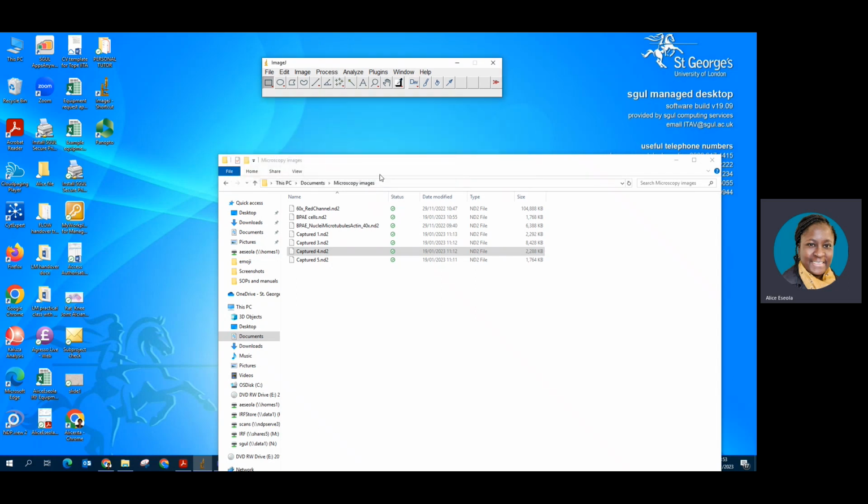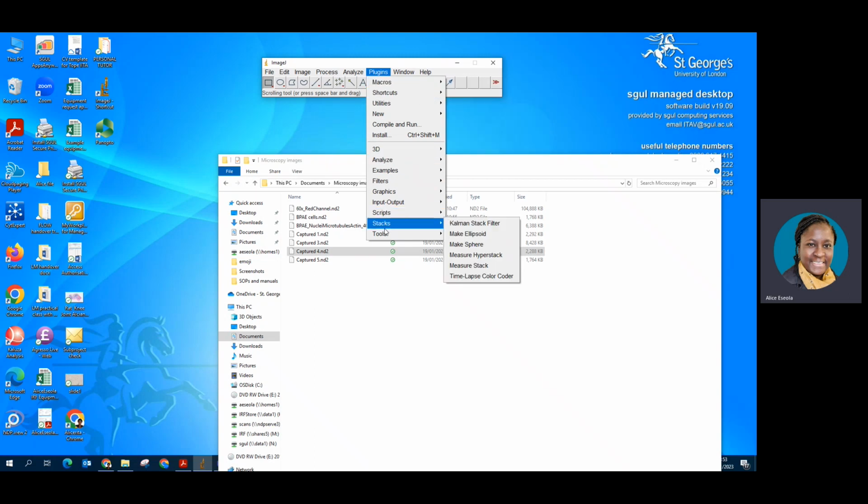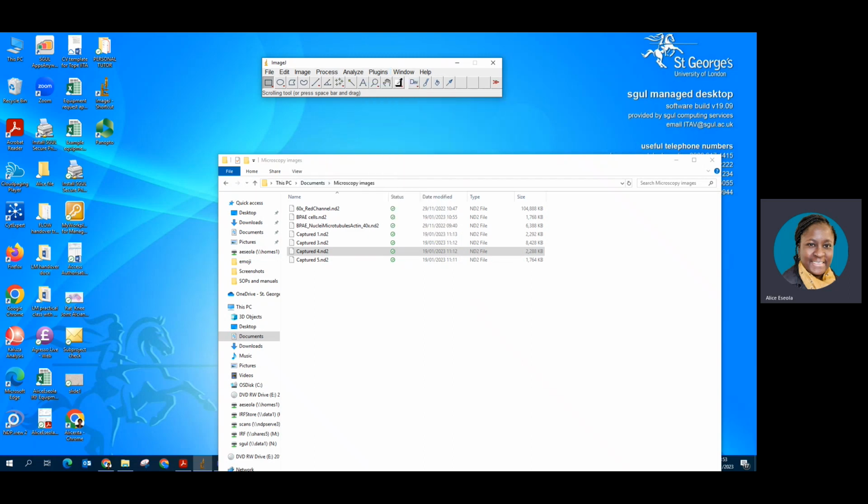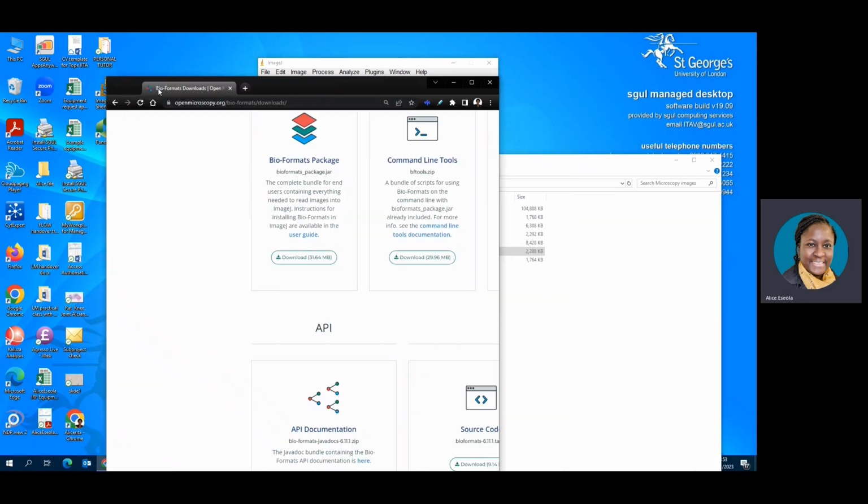This usually happens because you're installing ImageJ for the first time, and the plugins that you require in order to be able to open .nd2 images is not available. If you go to the plugins, you can see that here we have a missing plugin. You will not know it's missing because I'm using these plugins a lot. I was able to identify that this plugin was not automatically downloaded together with ImageJ. And this plugin is known as Bio-Formats, this plugin here.